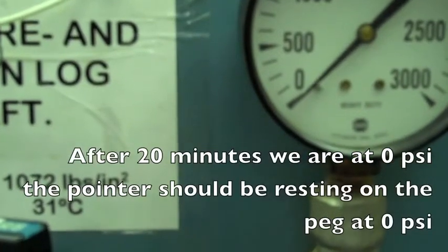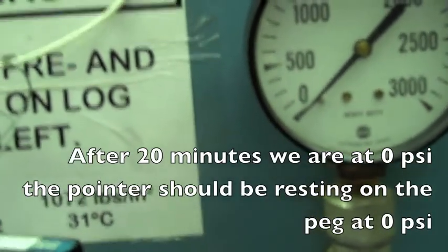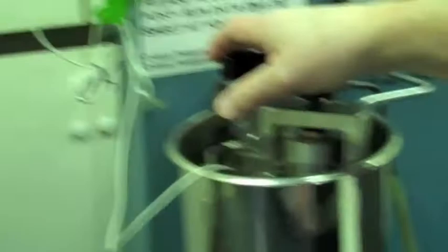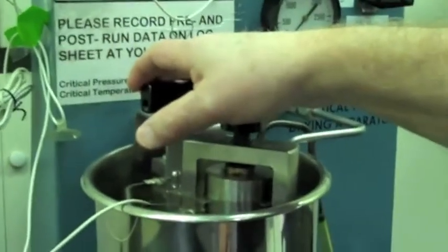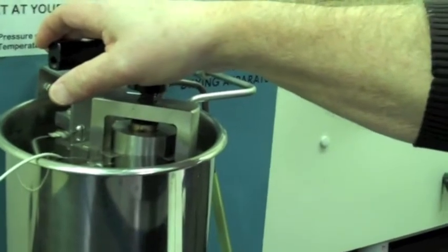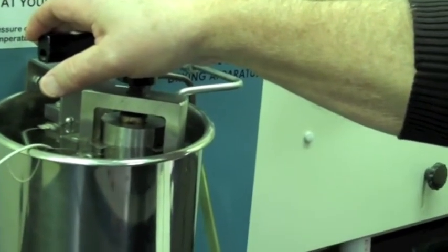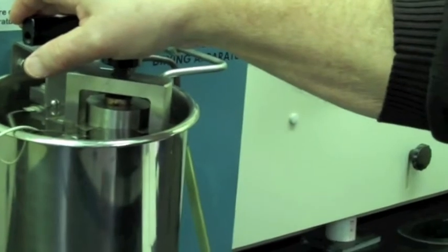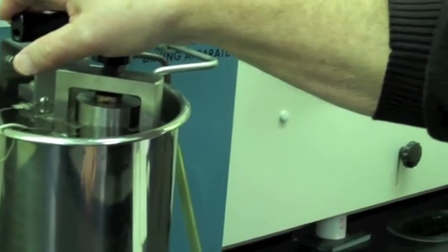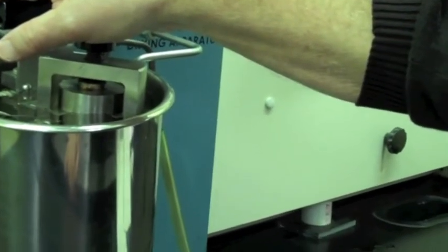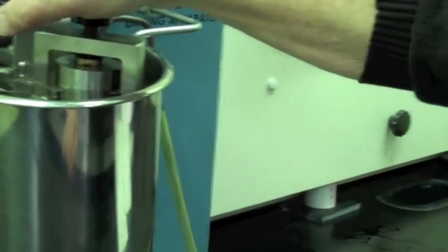It's kind of sitting on that. Drain all the gas in it. Now this should all be gas. There shouldn't be any liquid in there anymore because we're past the critical point where it changed over to a vapor. Which is the whole point of it.